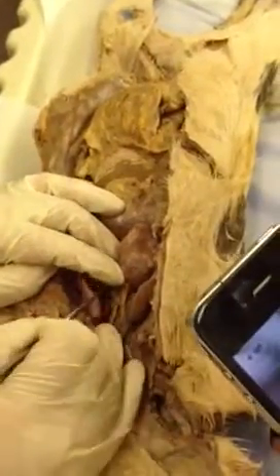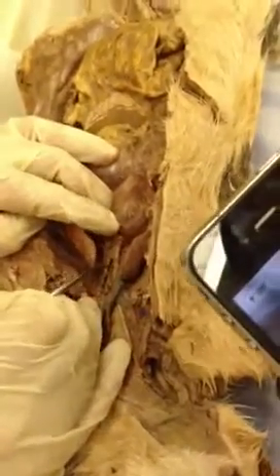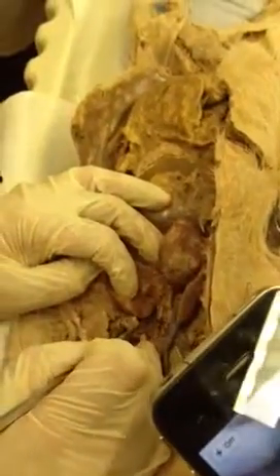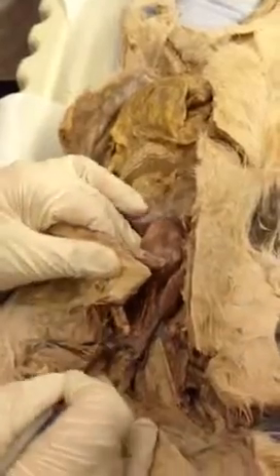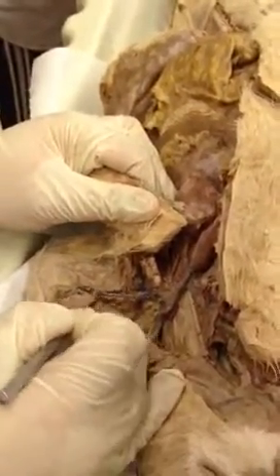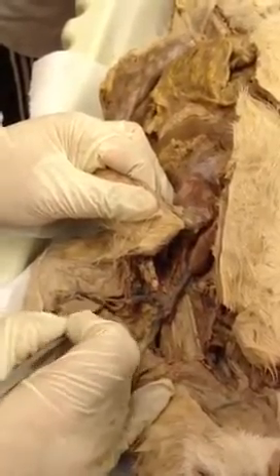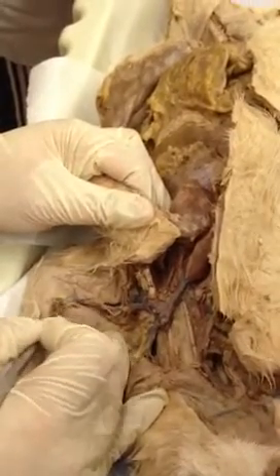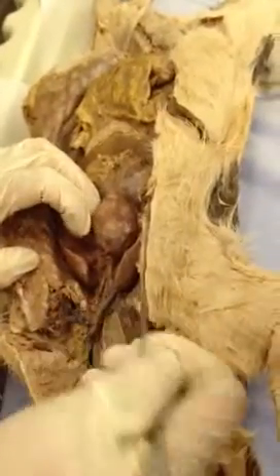Aorta, right? And then we have the aortic arch, which is not as clear on this one, but we can still see the 2 main branches coming over here on this cat, the brachiocephalic and the left subclavian, right? And then we can kind of see the system coming into the arm here again. Around the armpit, it's going to be called the axillary, and then here in the upper arm is going to be called the brachial, and then we kind of lose it on this cat, but we'll pick it up again on one of the other cats.